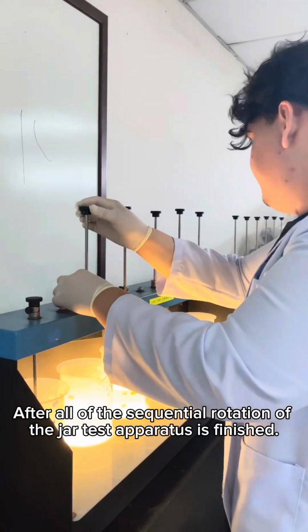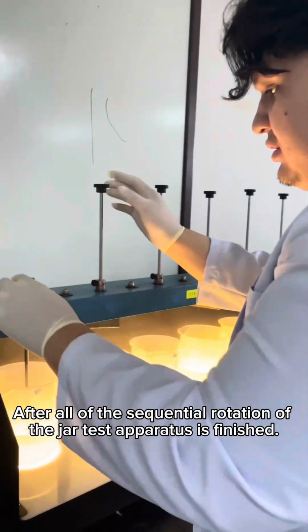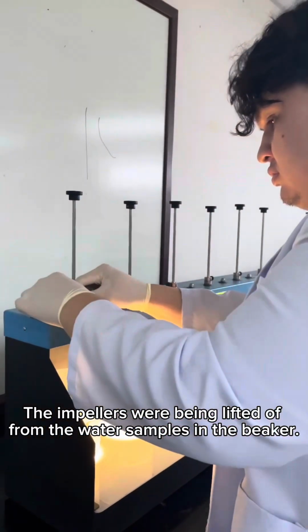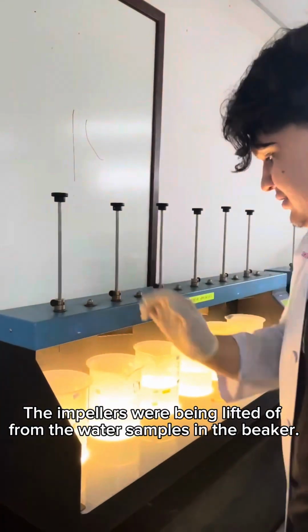After all of the sequential rotation of the jar test apparatus is finished, the impellers were lifted off from the water sample in the beaker.